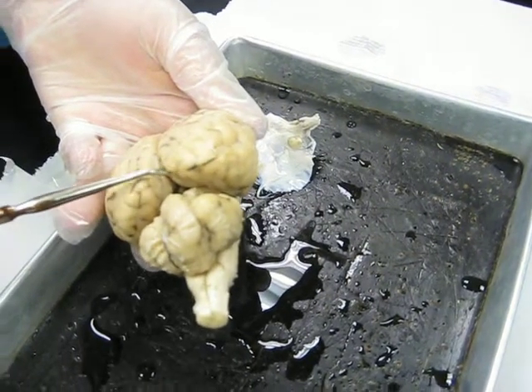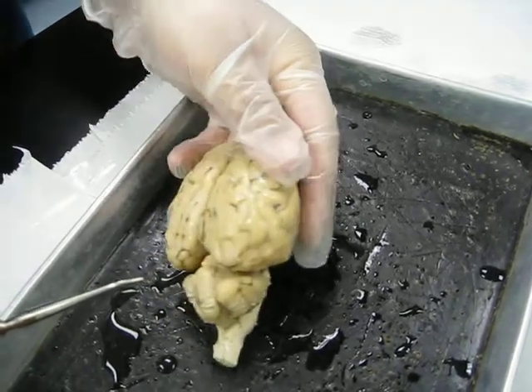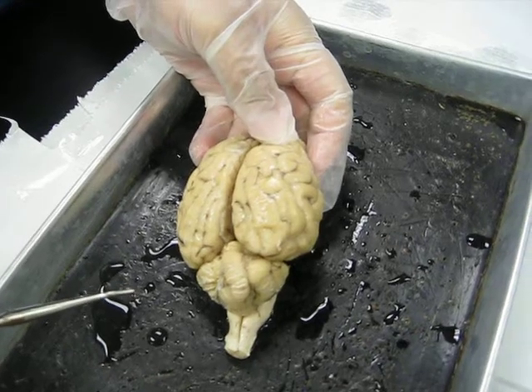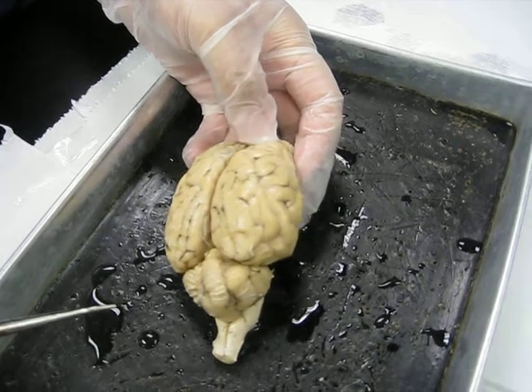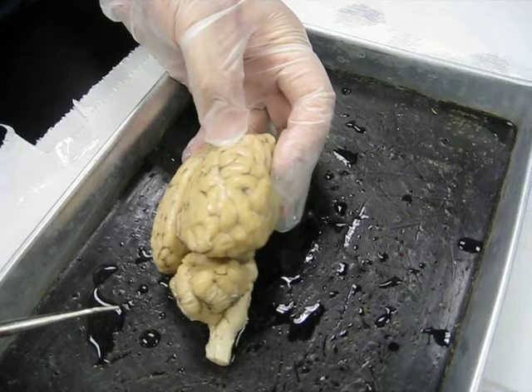Occipital. There's also a central fissure, which is a little difficult to see on a sheep's brain. It's a structure which is pretty remarkable on a human brain, but on a sheep's brain it's kind of indefinite. But basically it's a dividing line between the frontal lobe and the parietal lobe. I think on this brain our central fissure would be right along in this groove, not as deep as the other fissures.